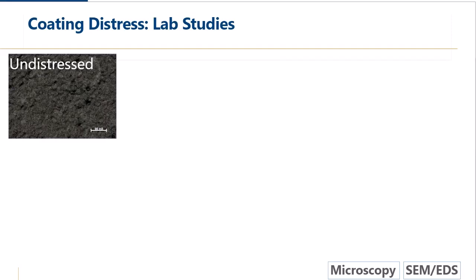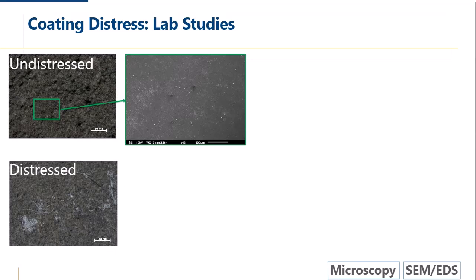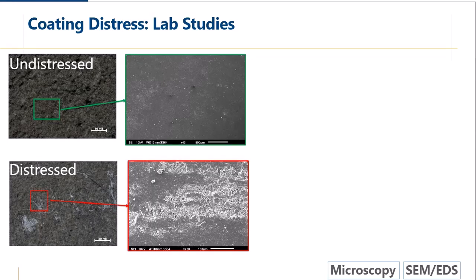So here's a micrograph of an undistressed panel, and you can see it's sort of uniform in color. It's a little bit bumpy, but it's mostly uniformly bumpy. Again, we put it in the SEM, we look at the surface, and again, it looks pretty uniform. We're not seeing much difference, which is not surprising, right? Because visually, we're not seeing any differences in the panel. It's pretty uniform. We look at one type of distress, and we look at it in the microscope. And these lines are sort of light-colored lines, but when you look at it in the microscope, they look almost waxy or like a material has been sort of scratched on the surface. And again, we look at it in the electron microscope, and again, we see abrasions on the surface. Nearby areas are smooth and uniform like they are in the undistressed sample.